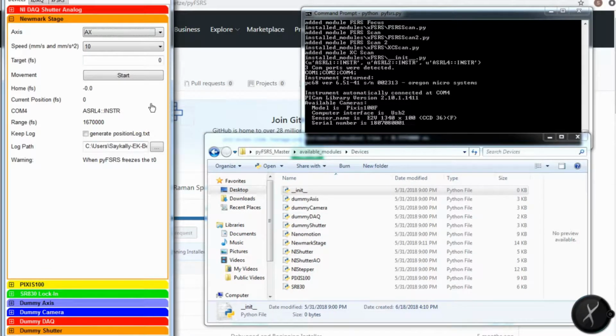This is a motion controller which actually can control 3 different translation stages. Right now I want to select AY. I can control the speed of the stage, so it's a 10, and then I can move it to, let's say, -400,000 femtoseconds. You move it by clicking start. You can also generate a position log down below, and what this does is report where the stage is and at what time, so that if pyFSRS crashes, you can recover your time point, and so you don't lose time 0. Log path tells it where to save the log file.